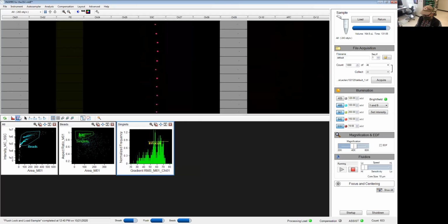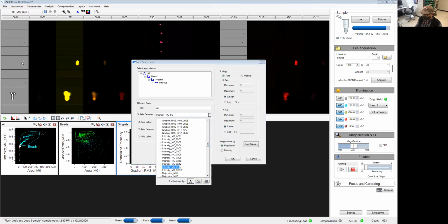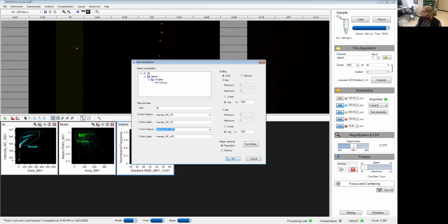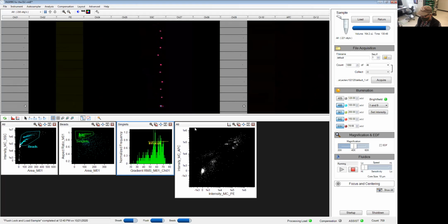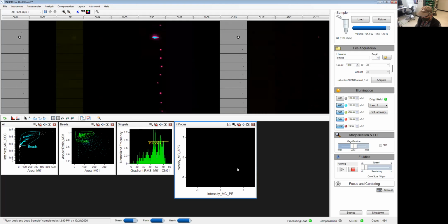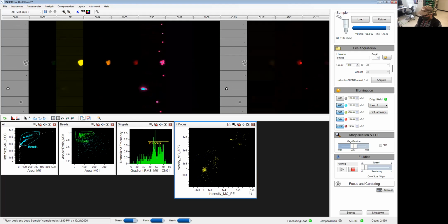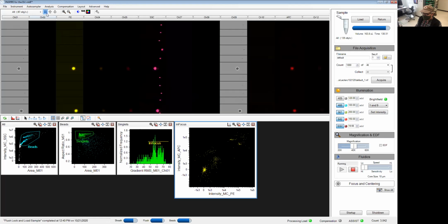And lastly, we'll do a graph to look at my two parameters. So here we're going to use the intensity of PE and APC. A few other features to look at. You could actually look at it at this point. Now, the question is, am I saturating the detectors? Are there any events that are too bright? One indicator that you are actually saturating your detectors is if you get stuff like this.